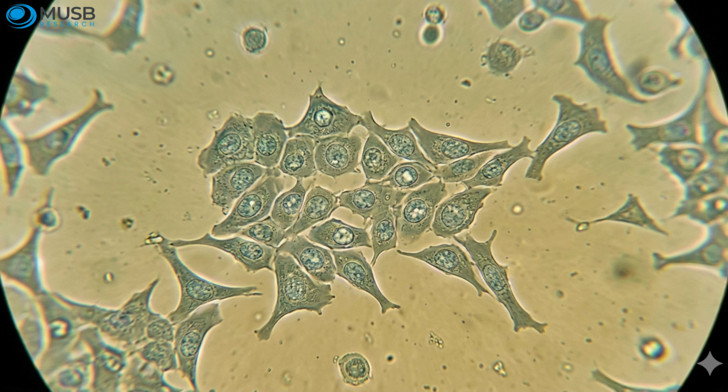How do you know if your cells are happy? You look at them. Every expert cell biologist develops an intuition for cellular health, and it all starts at the microscope. No lab? No problem. This episode gives you the complete visual vocabulary you need.